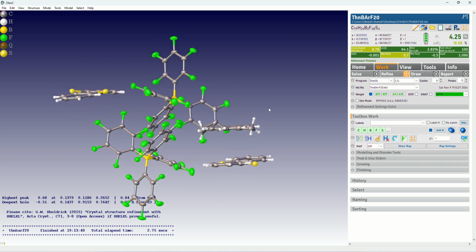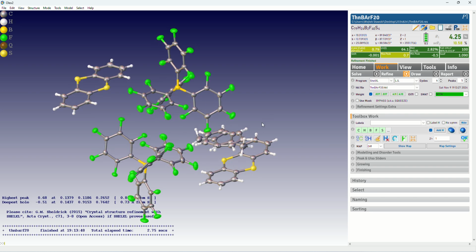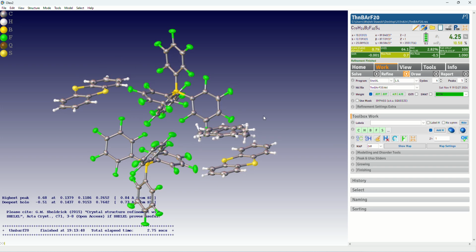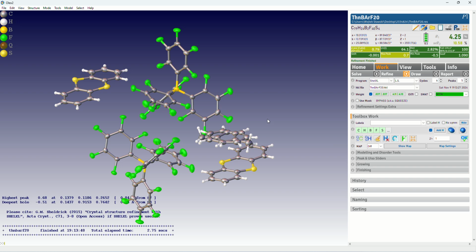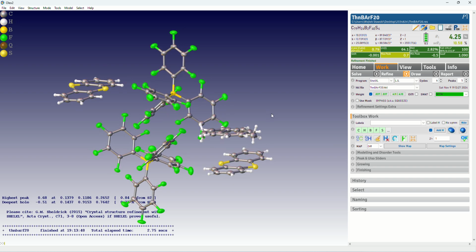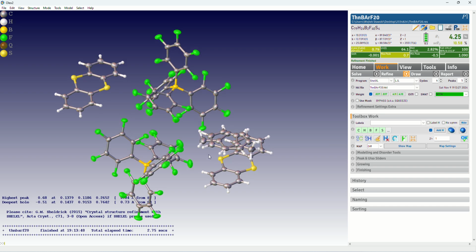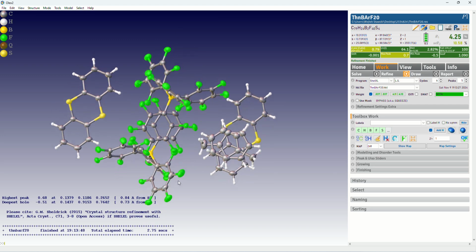And the thing that you have to remember when using solvent masking is that it's kind of a last resort. You should only use it if you cannot model your solvent, if it's so terribly disordered you can't do anything. Basically, you can do it when it's so disordered that modeling that disorder would be like fitting a ChemDraw to a big blob of electron density. Then it makes sense to use solvent masking. But in cases like that one, where we were able to model it very quickly, we should absolutely not use it. But we use this data set to show you how to use solvent masking.